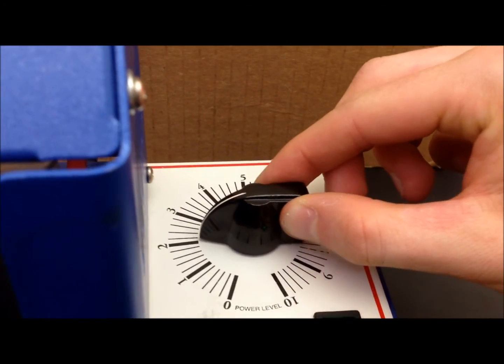So that way we can monitor our sample and get a more accurate range of its melting point. We need to make sure that we note the melting point value of the first droplet of liquid. And we also need to note the second value of when the sample is completely liquid or melted.